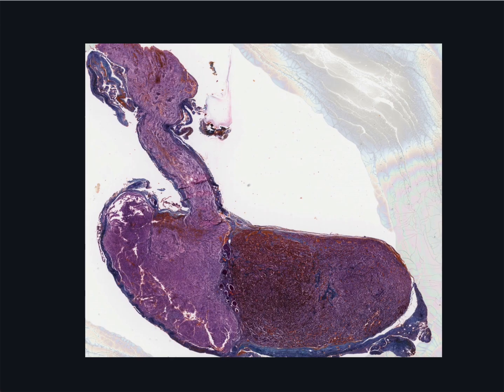The epithelial cells of the adenohypophysis can be grouped into three classes on the basis of staining characteristics: chromophils, which include acidophils and basophils, and chromophobes. And even at this low magnification image, you can appreciate this distinction.